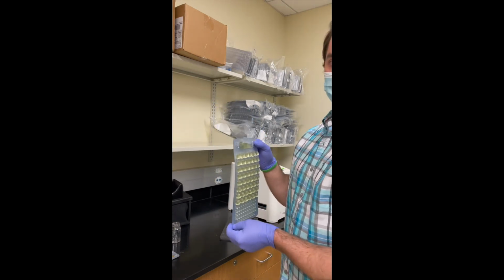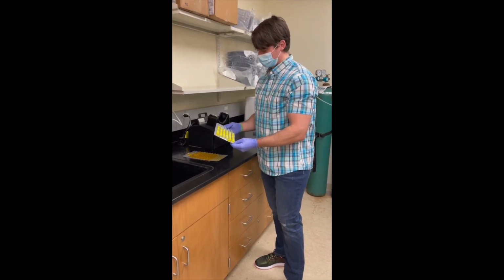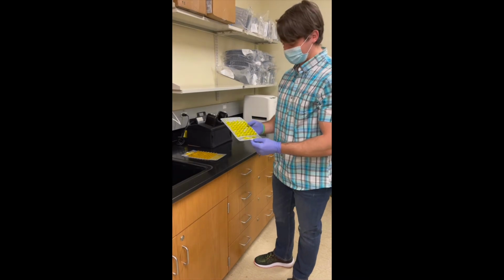We'll now be cutting to a counting of the sample. Good. Okay guys, so this is essentially part 2. It might be cut together in the same video if I can figure out how to do that.